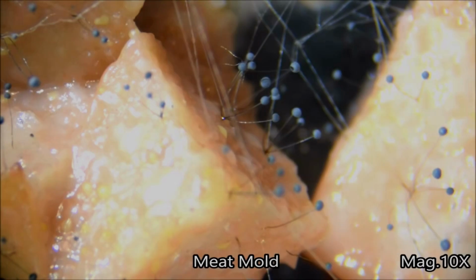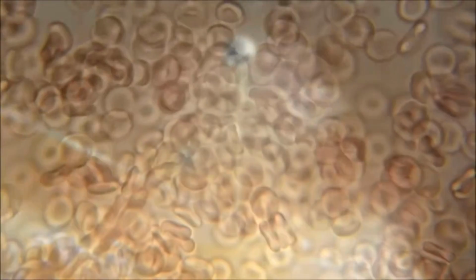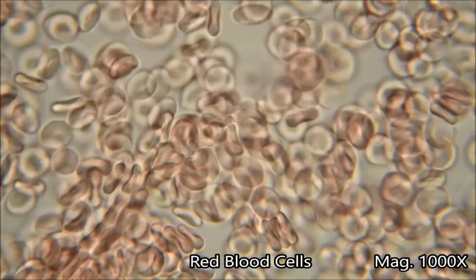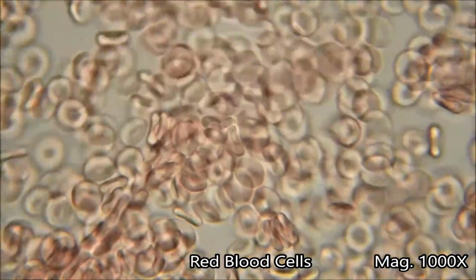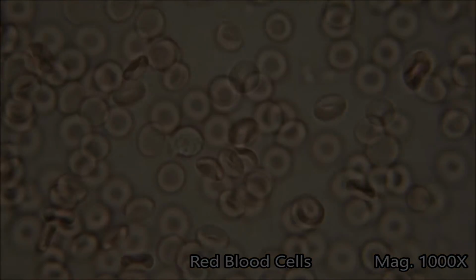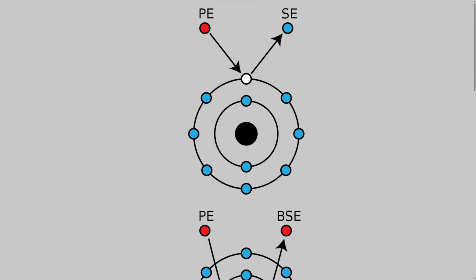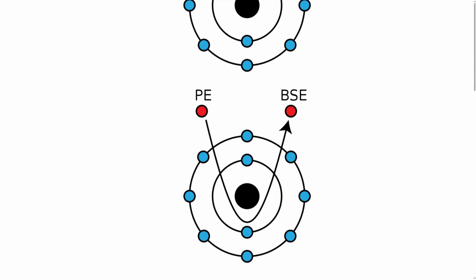People have been using optical microscopy for almost 4 centuries. People use magnifying lens glasses, and with a source of light you can see the object. However, since physics progressed in the beginning of the 20th century and we discovered the electrons, the atoms, and the composition of the molecules, we could start using electron microscopy.